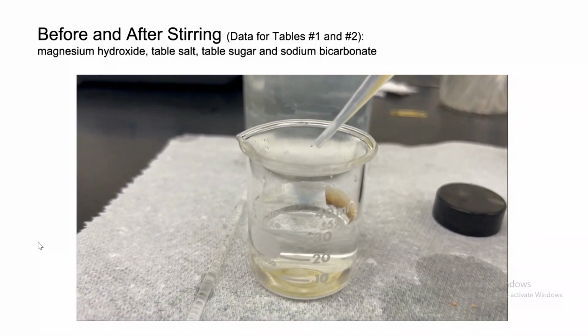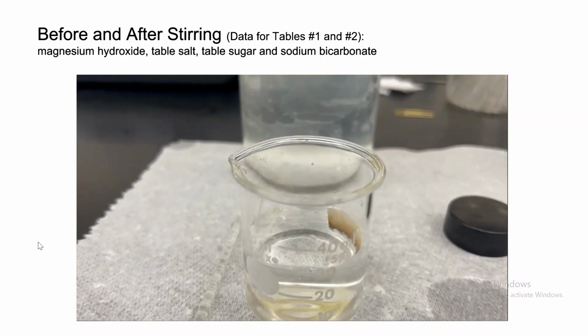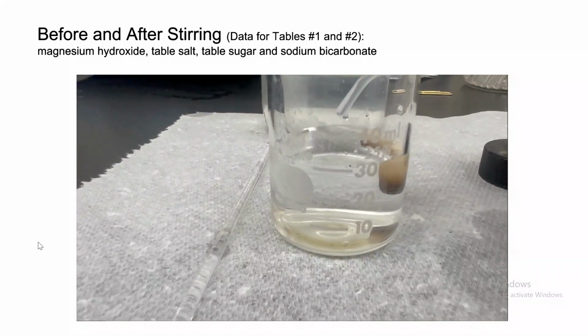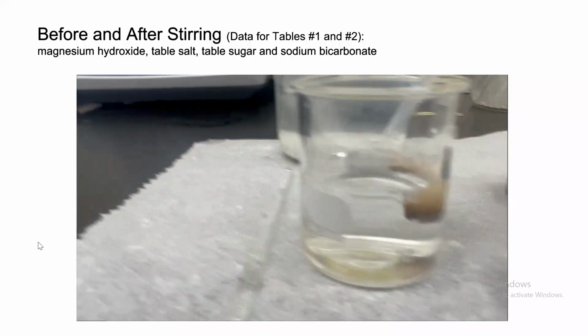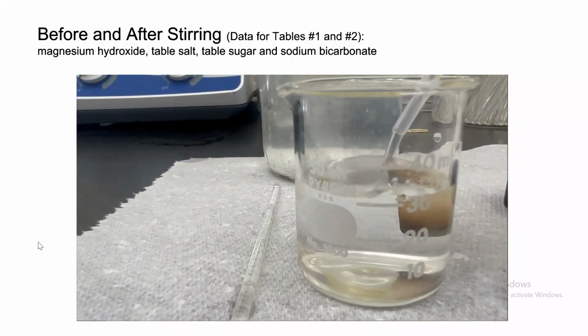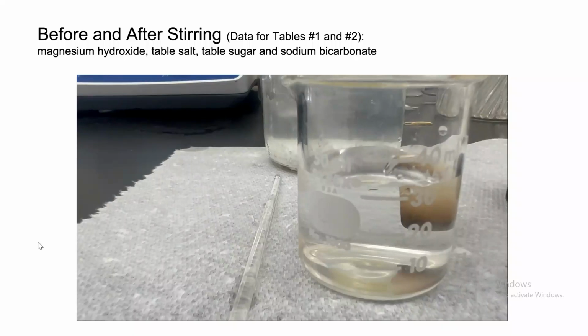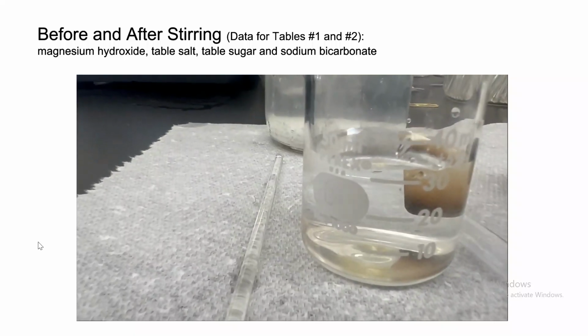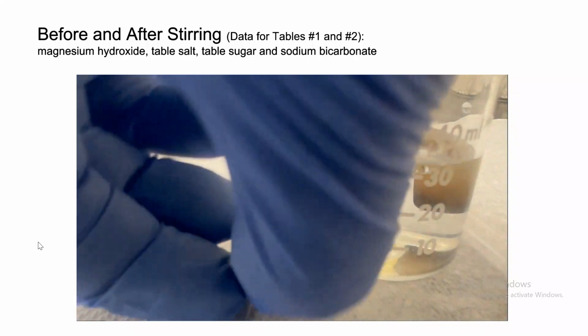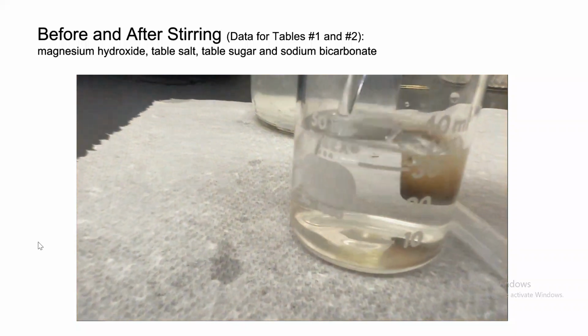Now, does it sink or does it float? Let's see. If you look closely, you'll notice it might not be visible because it's actually mixing. Magnesium hydroxide actually sinks. So you're gonna write sinks and it's more dense.